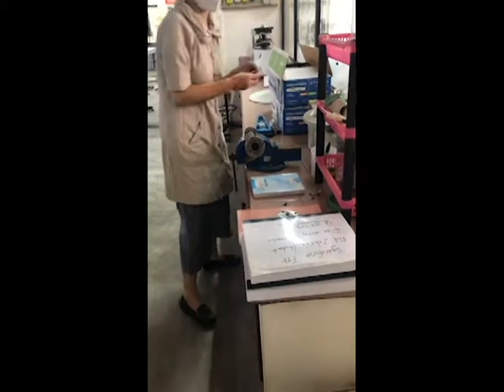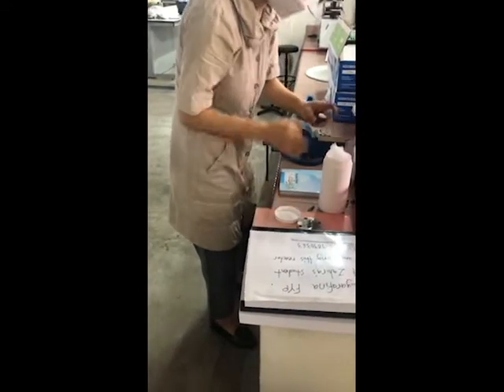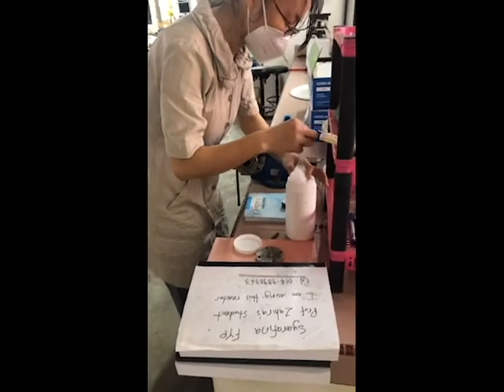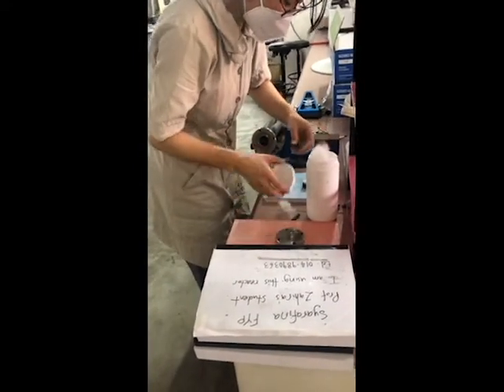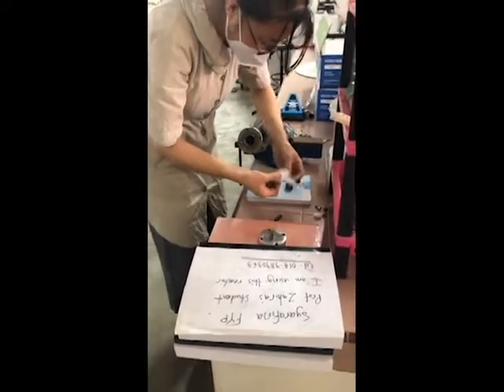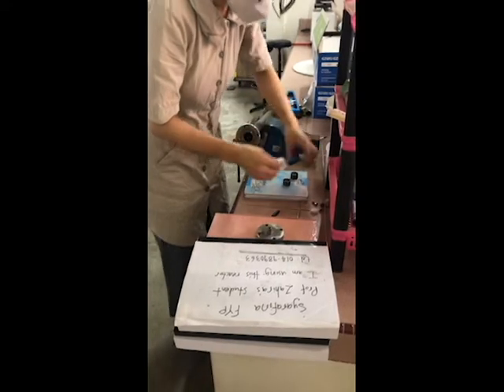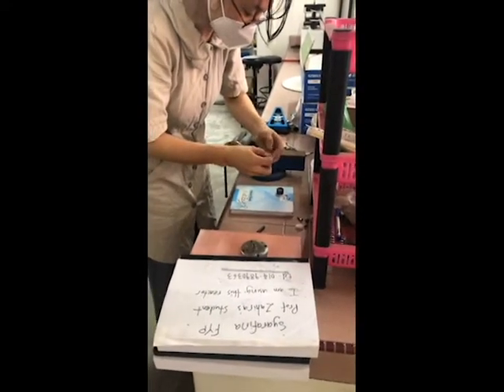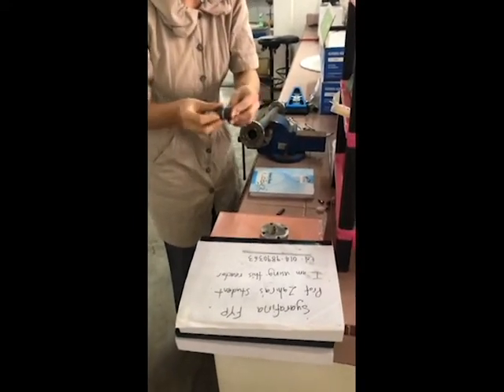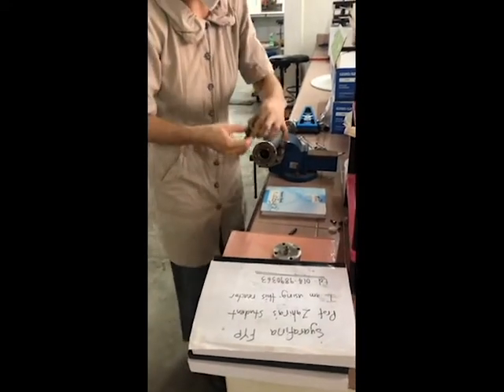How do you specify the amount of quartz wool? Wear gloves when you handle quartz wool because it's itchy. The latex gloves. Cotton gloves are protection for heavy duty, but they cannot protect you from the itching. But okay, I will wash my hands immediately. So you cannot cut the fiber, you're breaking the fiber. Just press it into the center and lock it. Some may stick out, but you don't need to swap it. You just let it go in.